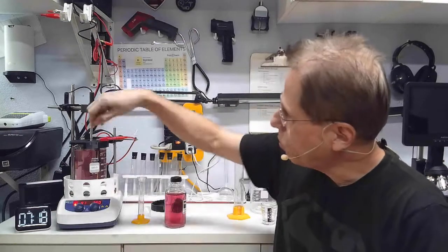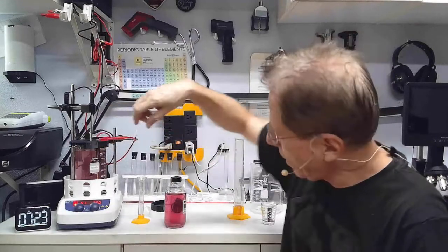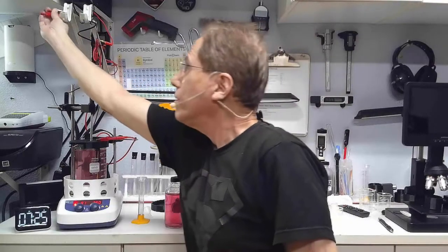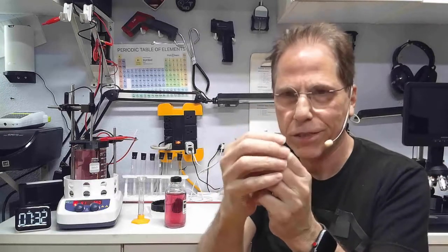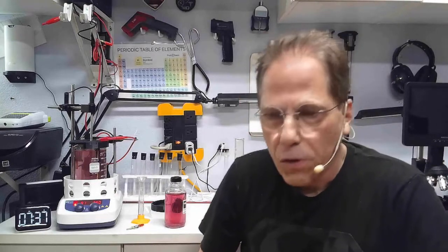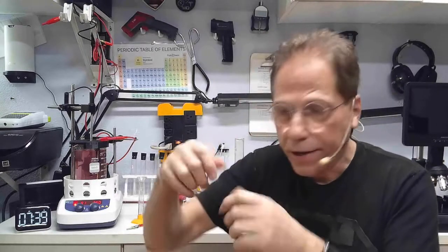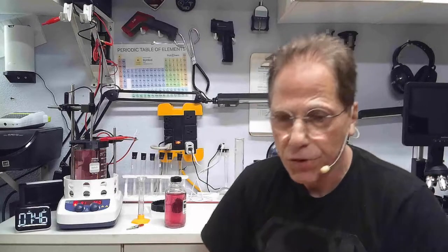You just want to put half the coin in the liquid. You do not want the alligator clip going into the solution, or you're going to be cooking whatever material your alligator clip is made out of. You can rotate the coin around - you cook half the coin, then rotate it the next time you cook gold and cook the second half of the coin. That'll keep your coin even for those of you using gold bullion.